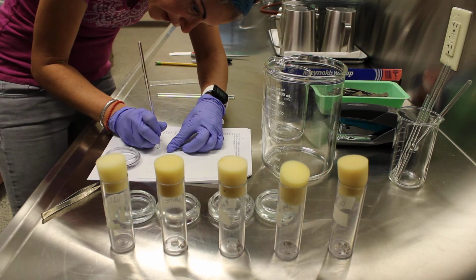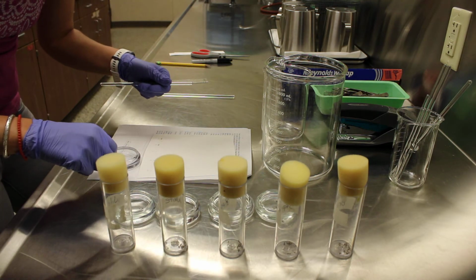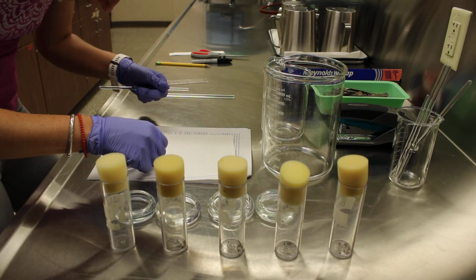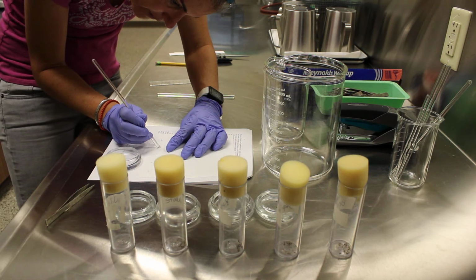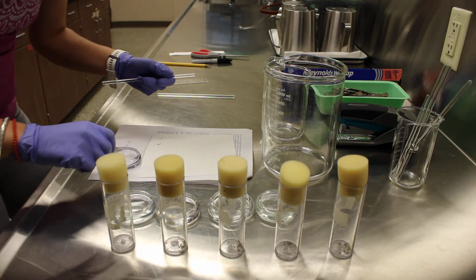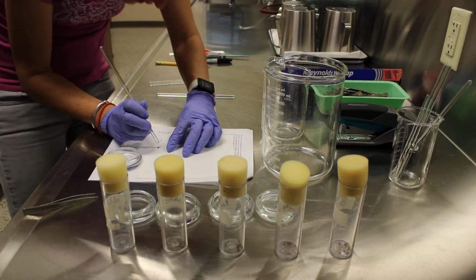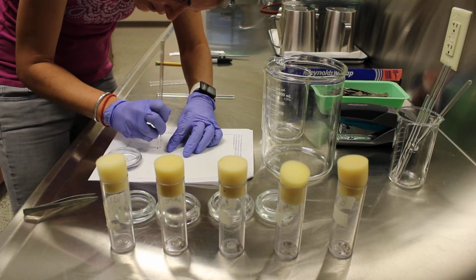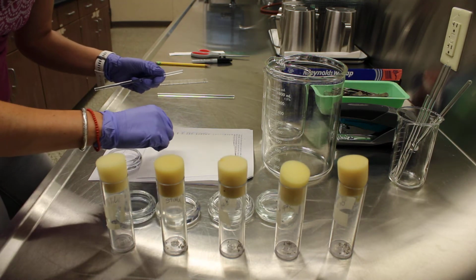So I switched my rod, and now I'm going to smash these guys' heads, 4 of them, on the brown spot. It's hard to just get their heads, but I'm doing the best I can. Here's the 3rd one, and a 4th one.